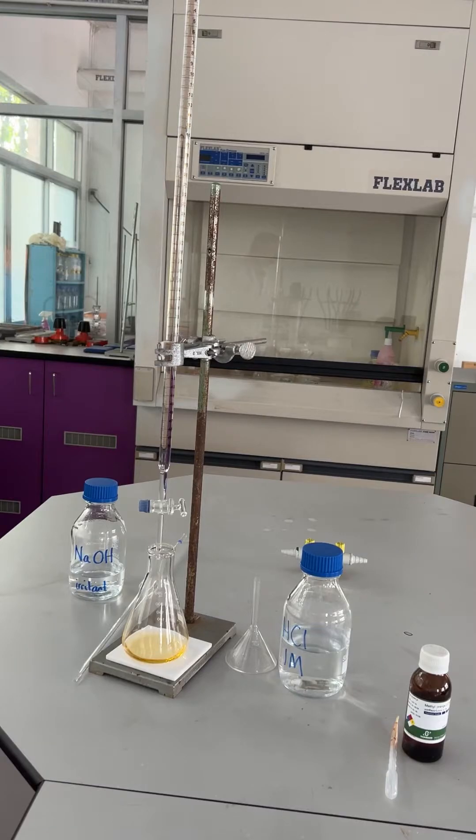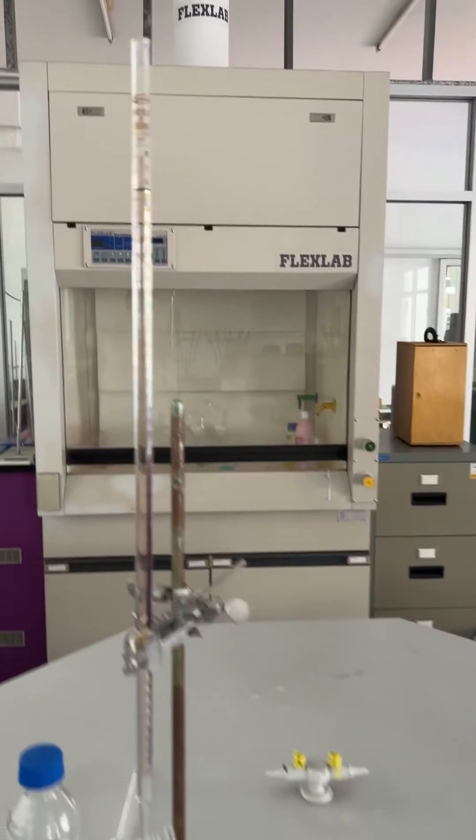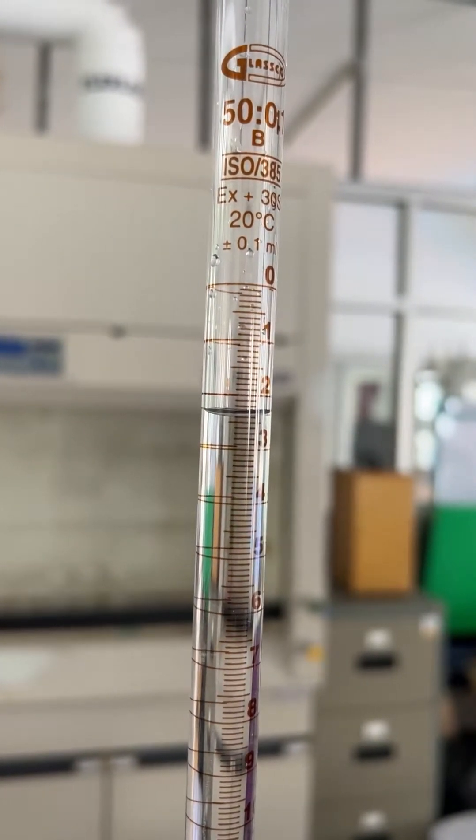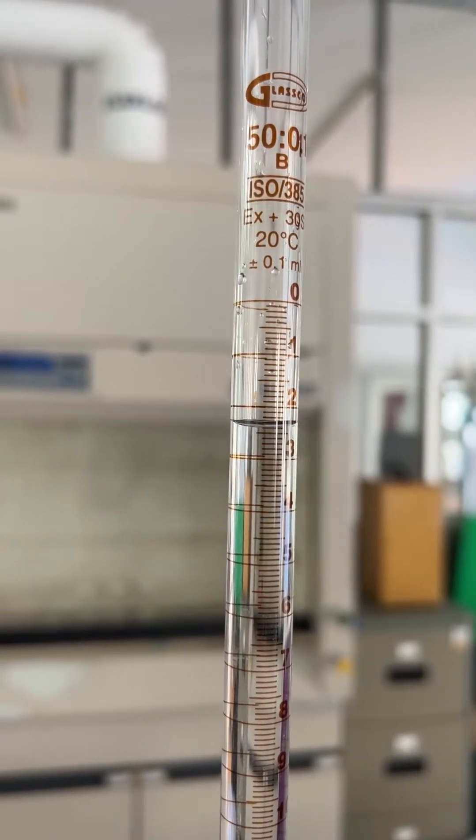Let's take the initial reading on the burette. And that is 2.4 cubic centimeters.